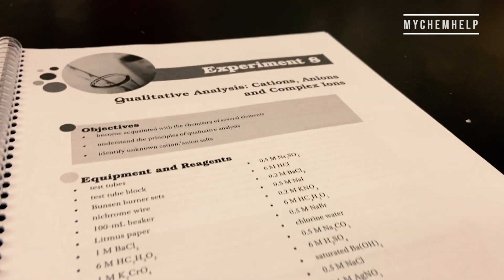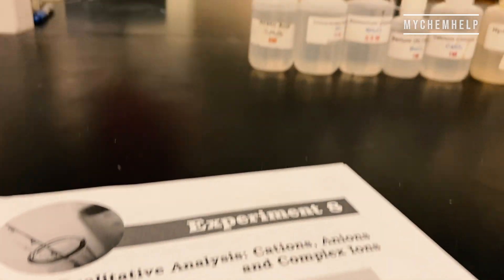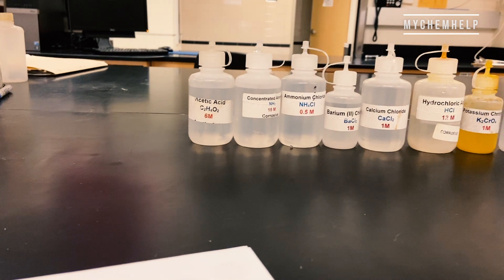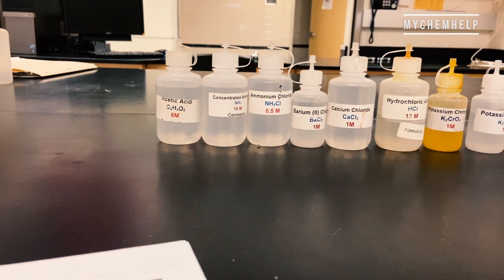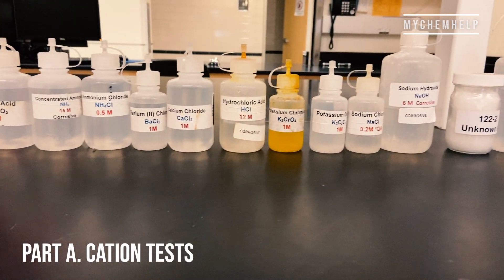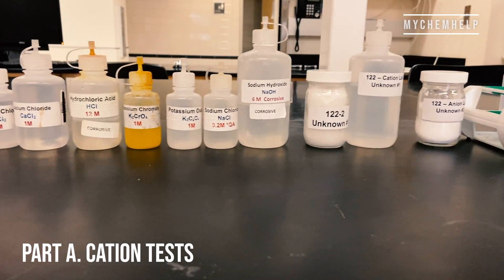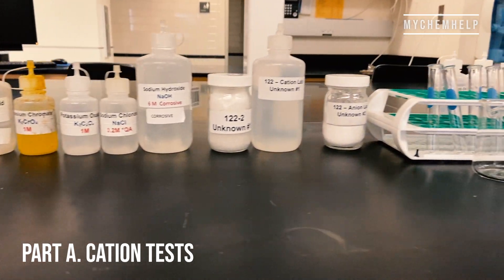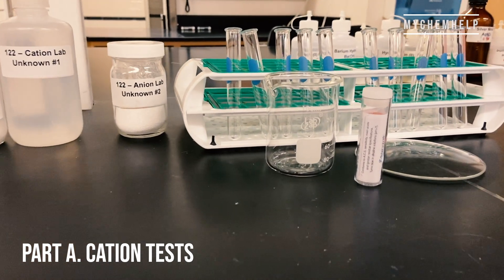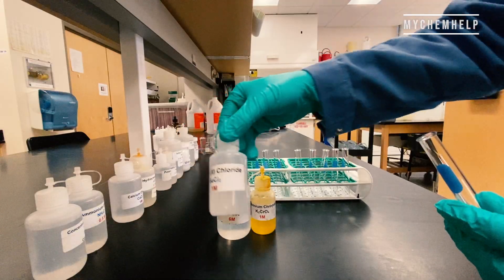Today I'll be showing you guys a qualitative analysis lab. This lab is pretty cool because we're pretty much just dropping some chemicals into test tubes and seeing what happens. In part A I'm going to test for specific cations, and then in part B I'm going to test for specific anions.